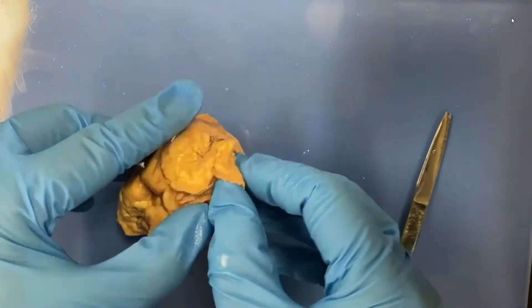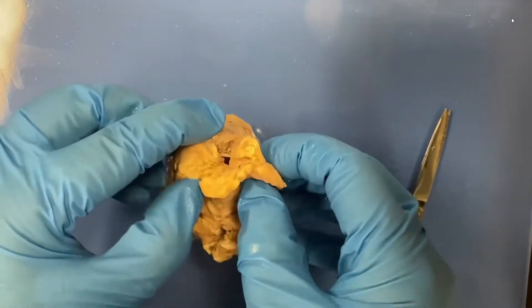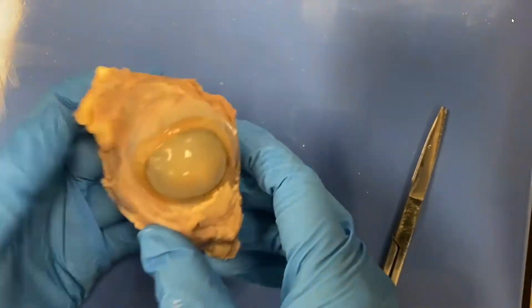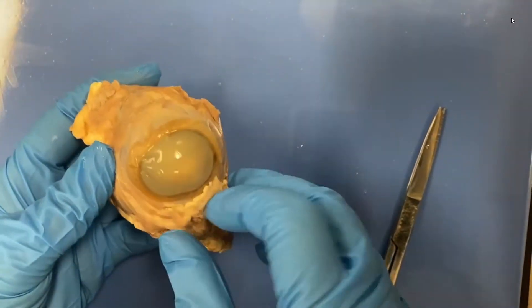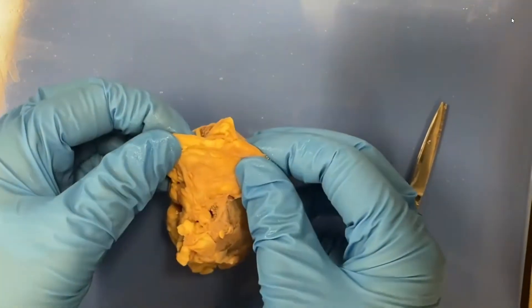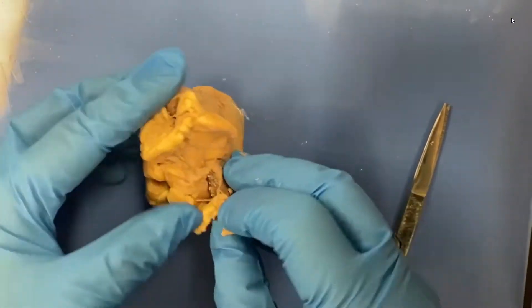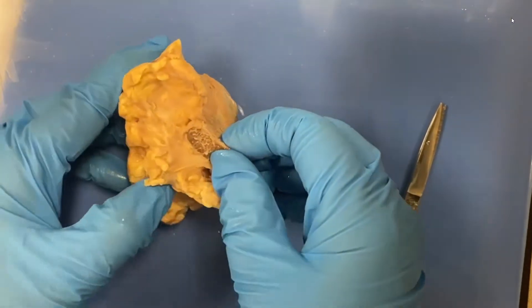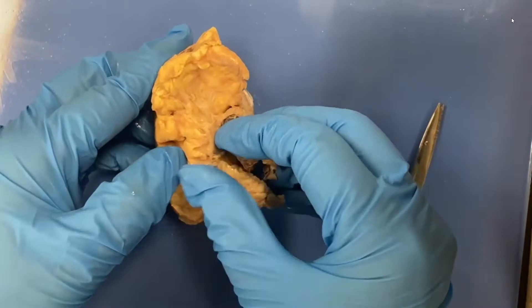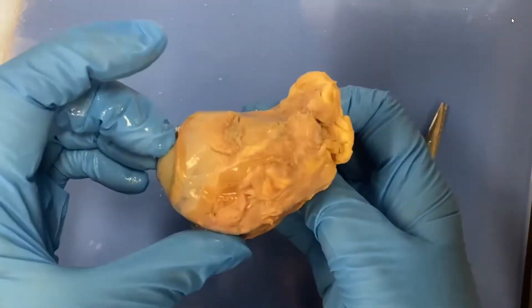You can see there's a lot of fat around it. Fat is protective, and so this fat around the eye, which sits in the orbit, is called the periorbital fat. We're going to go back here and try to find the optic nerve, because that's going to help us orient ourselves.